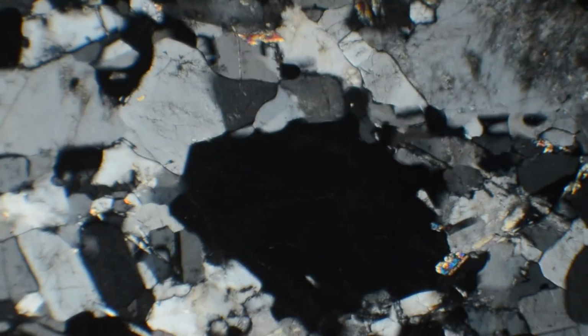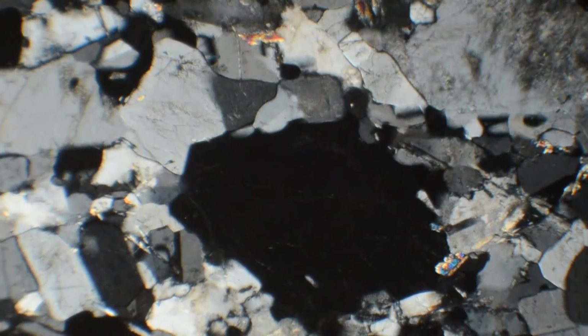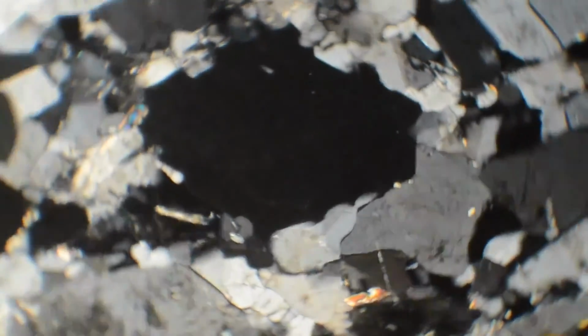Now it's your turn to try an example. Here I go from plain polarized light to cross-polarized light. I've chosen a grain with low retardation. Then I switch to the highest objective, focus, and then put in my condensing lens and my Bertrand lens. Take a moment now to orient your quadrants.